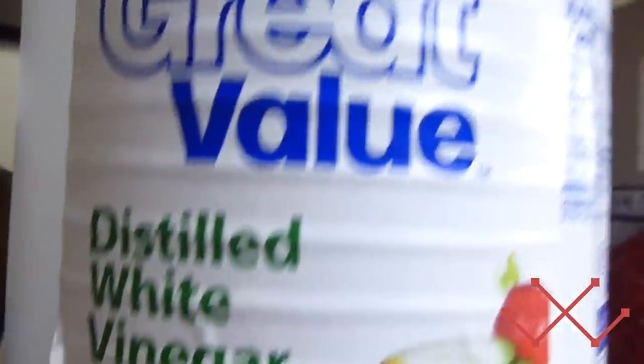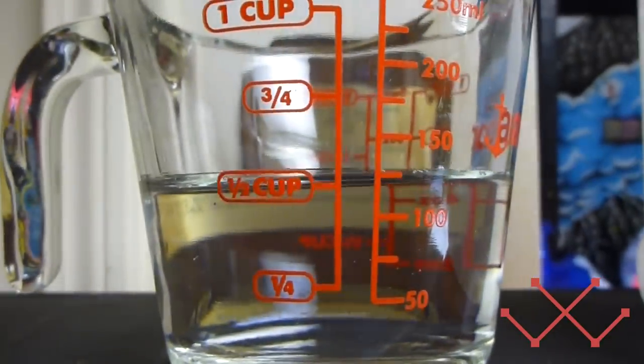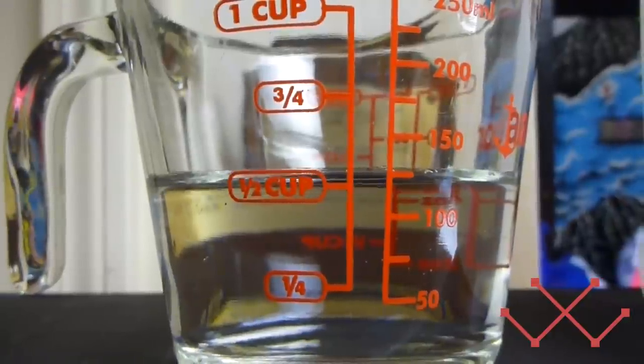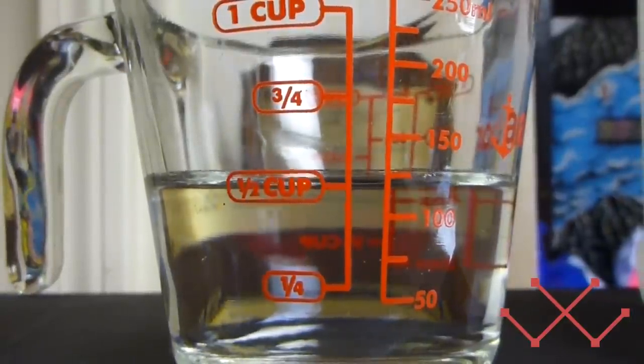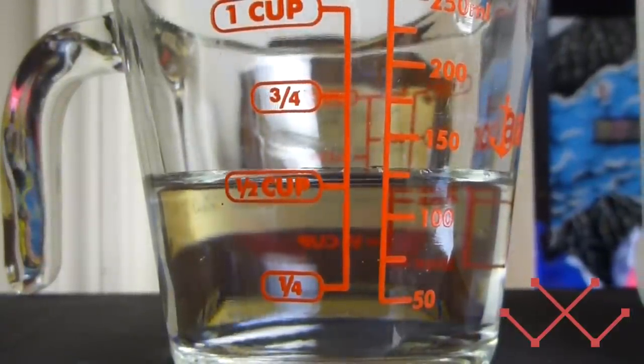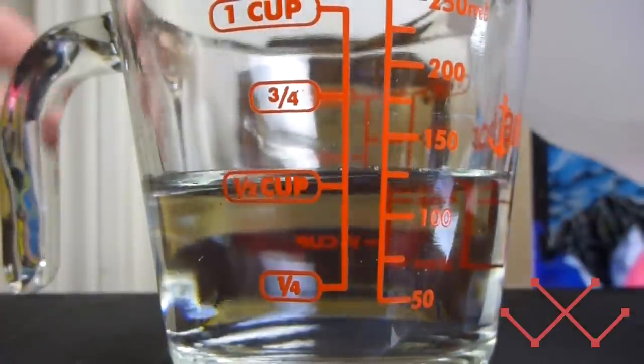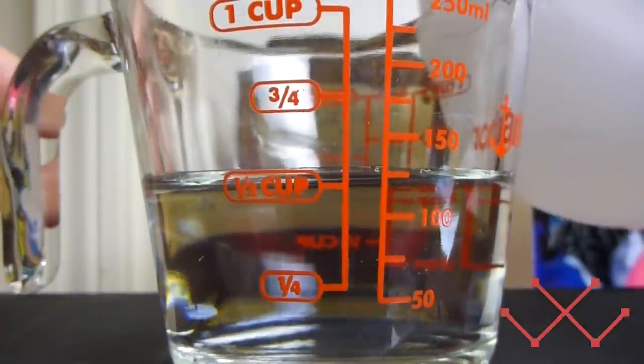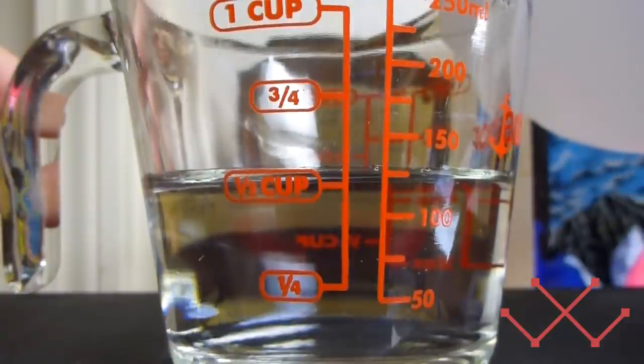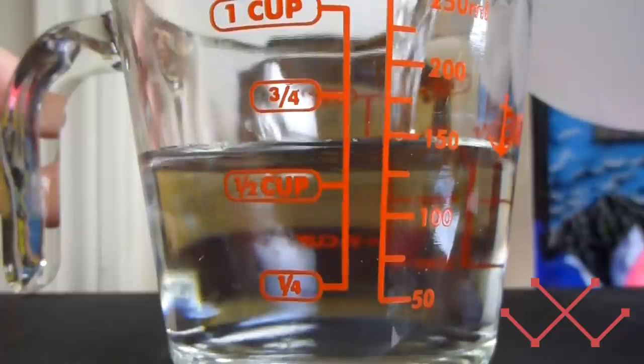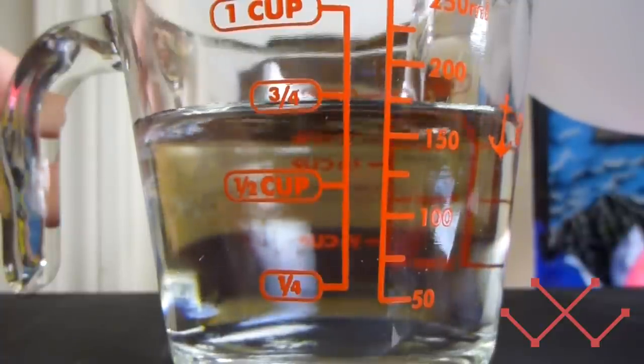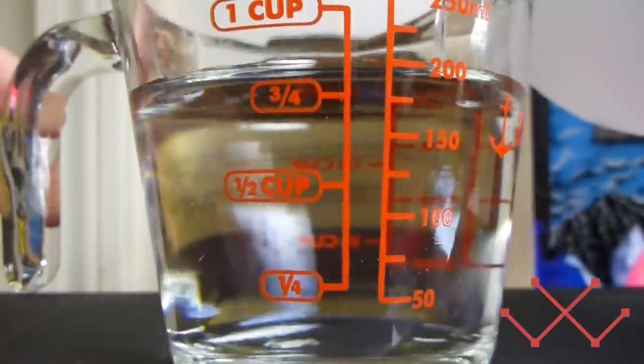Then you need to get some white vinegar. Now, white vinegar isn't perfect because it's got impurities. But it's the most readily available. And it's got the fewest impurities of any vinegar that I know.